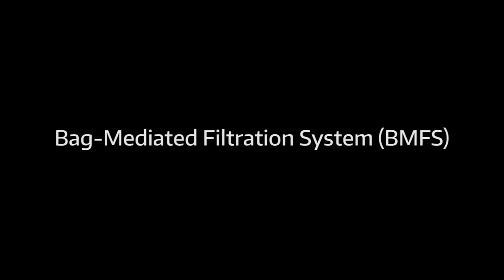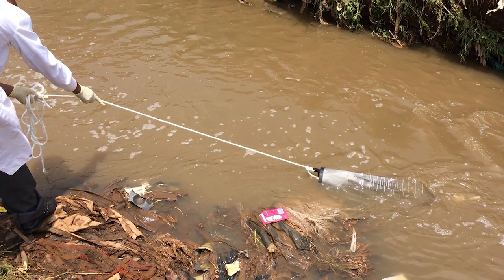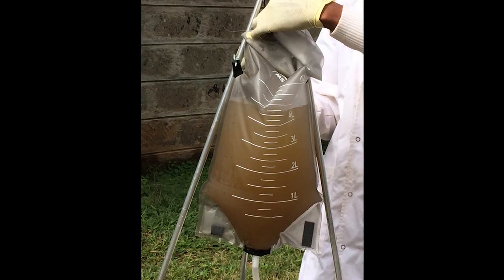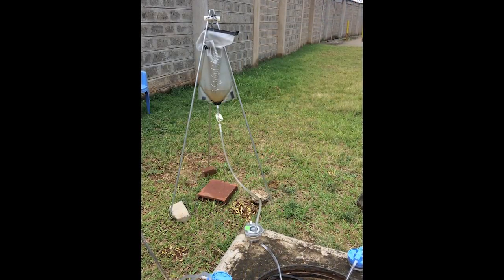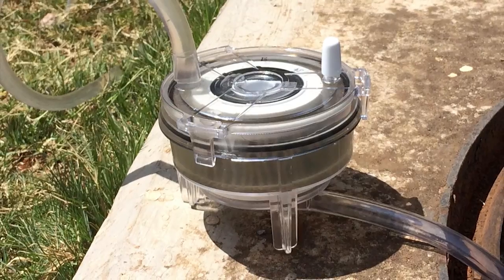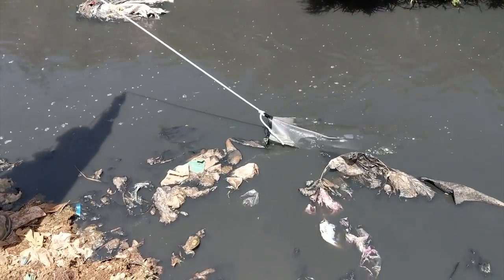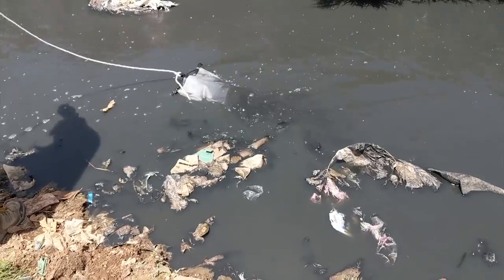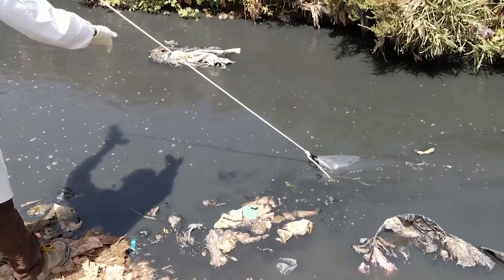This video introduces the field protocol for an environmental surveillance method called the bag-mediated filtration system, or BMFS. Using the BMFS, the sample is collected in a bag, which is then hung on a tripod stand. The sample filters by gravity through a ViroCap filter, and pathogens are captured on the filter. This proven method enhances the probability of detecting enteric pathogens in the environment, which is an important step towards improving public health.